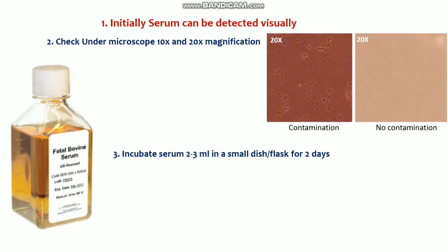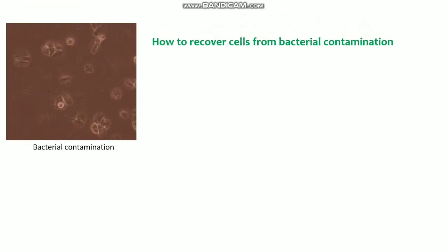Alright. Next, I will talk about how to recover cells from bacterial contamination. As you see in this figure, there is some bacterial contamination. If you see the background, there is a noisy background, and these are the bacteria actually. This is the 20x magnification you can see under the microscope.